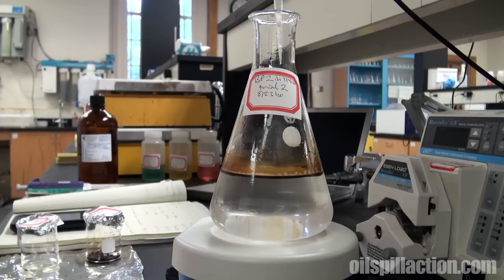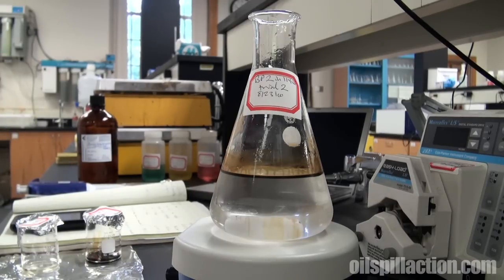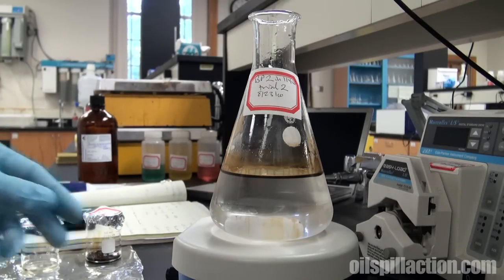The first thing that happens, you can see that the oil instantly races to the sides of the glass. And now it's starting to adhere to the glass. Let's turn the stirrer back on.